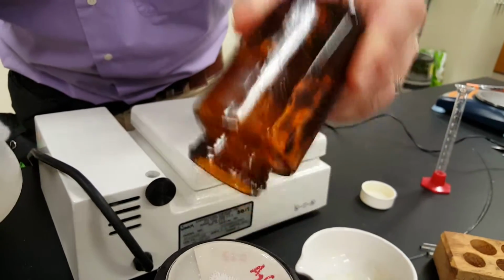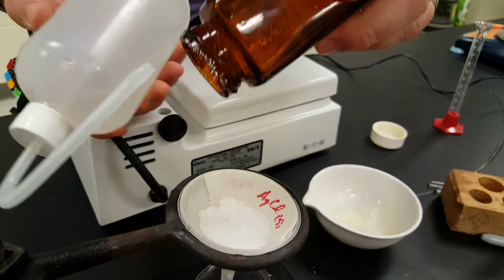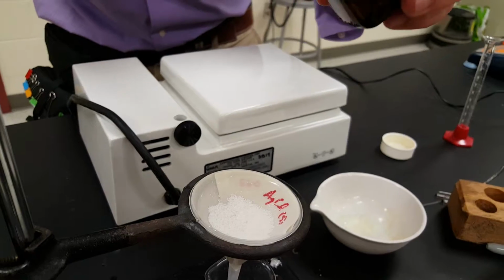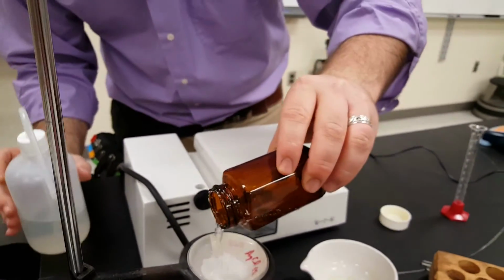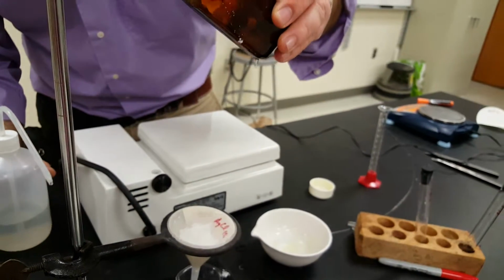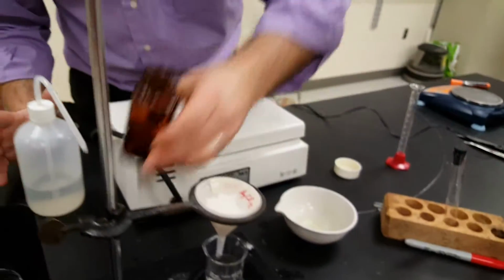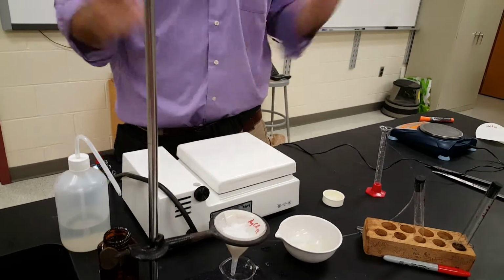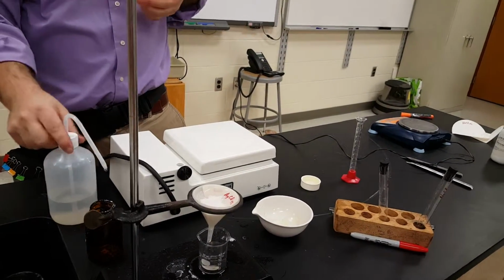Right now the filtration's going pretty good. Maybe I can get lucky and get some of this out of there. So just as a preview for tomorrow's video, I got a feeling, working at Kodak with this stuff as long as I did, that Mr. Monaco's hands are going to turn black today, as soon as he walks outside into the sunlight, because sunlight's got more energy than these tube lights. It used to happen to me all the time on the way home from work.